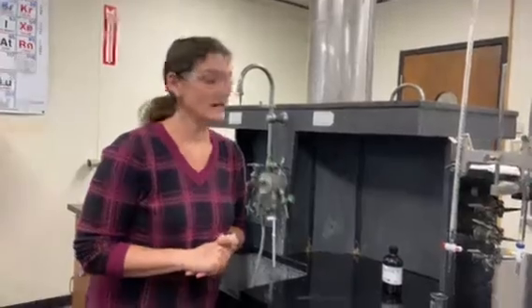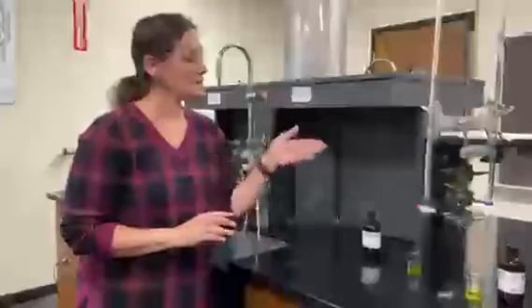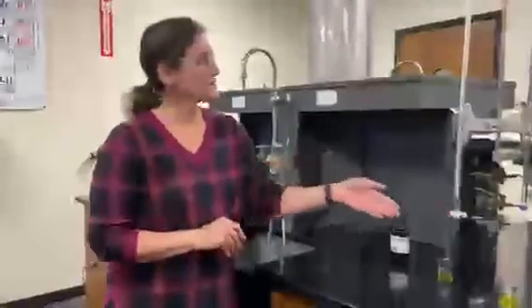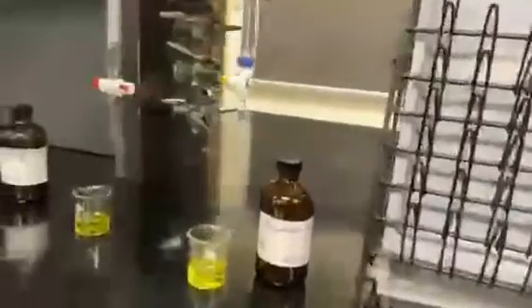All right, in this lab, we're going to look at the solubility product constant. In each one of these burettes, we have differing solutions of silver acetate, a sparingly soluble solid in a solution. In this one, we have just silver acetate, that's solution A. In the next one, we have silver acetate with potassium nitrate.